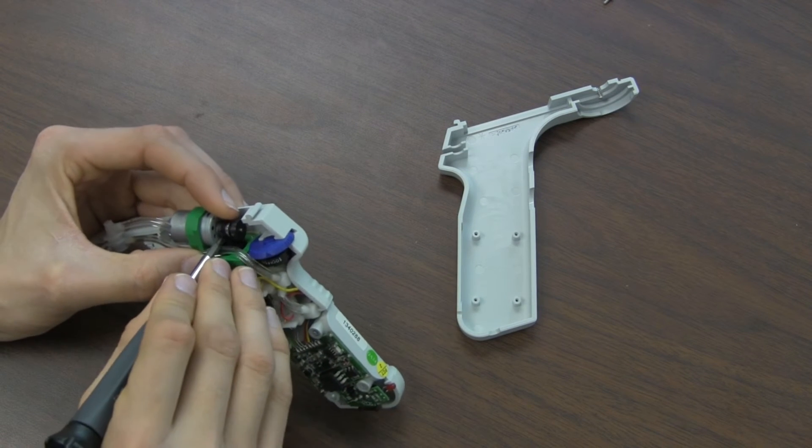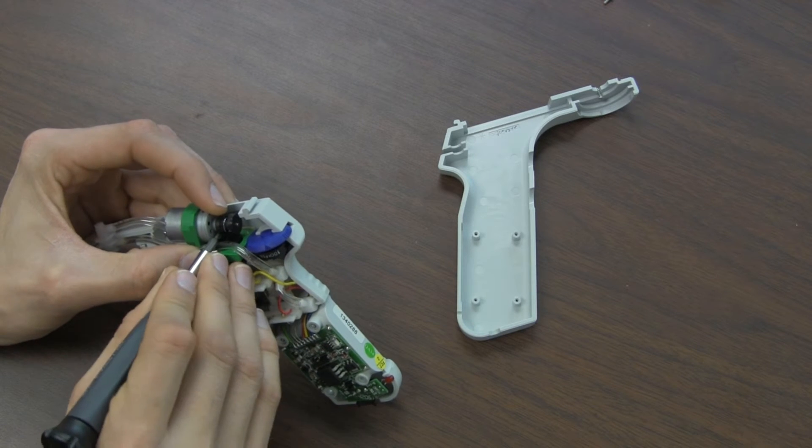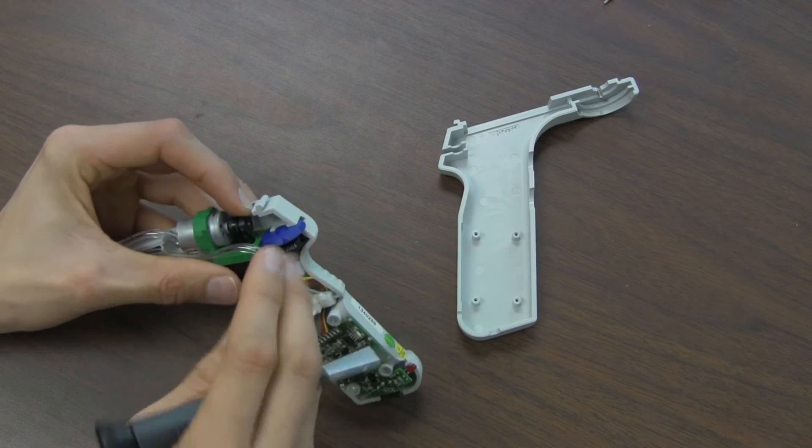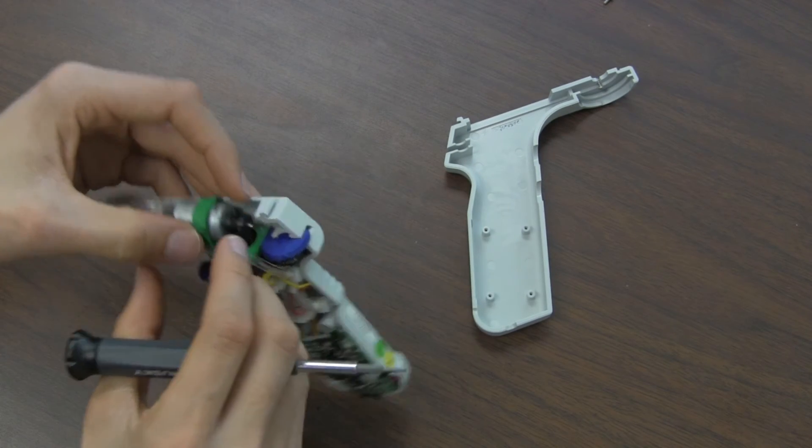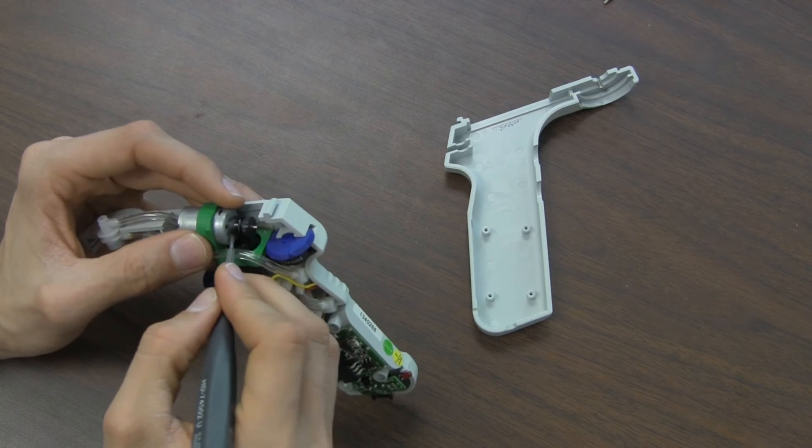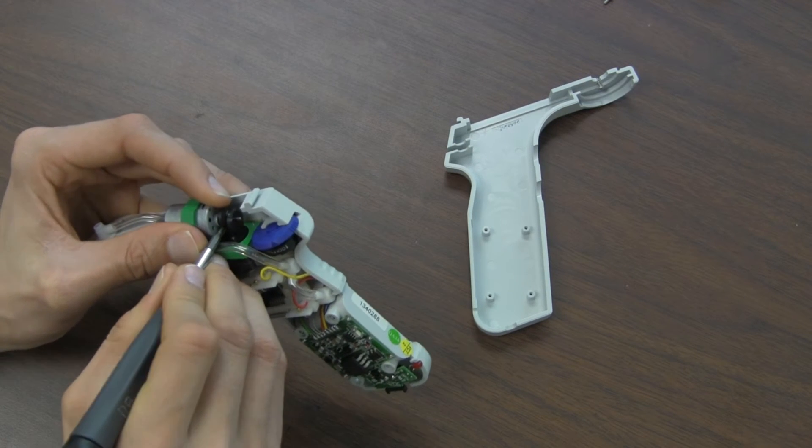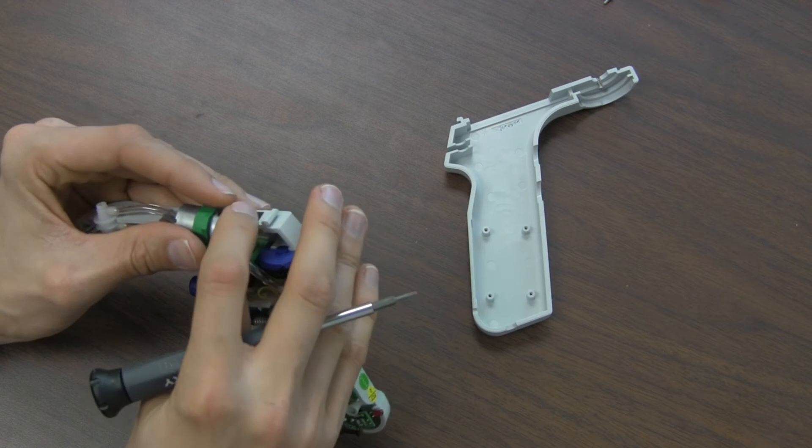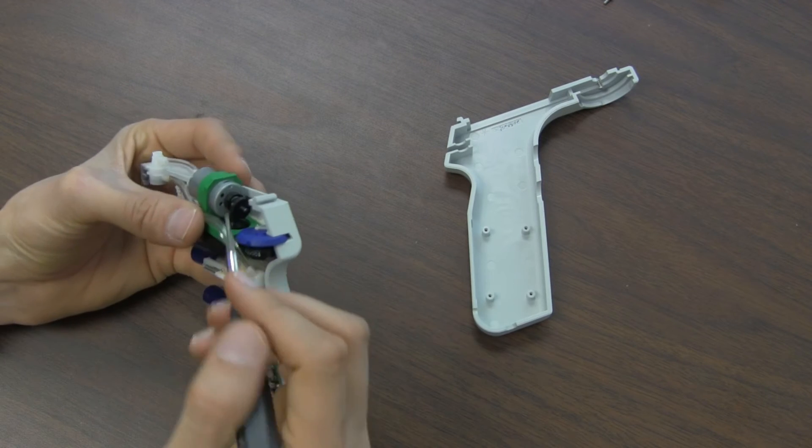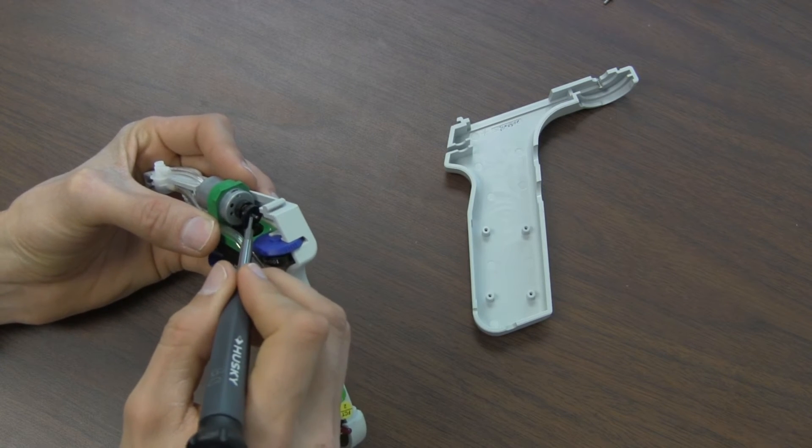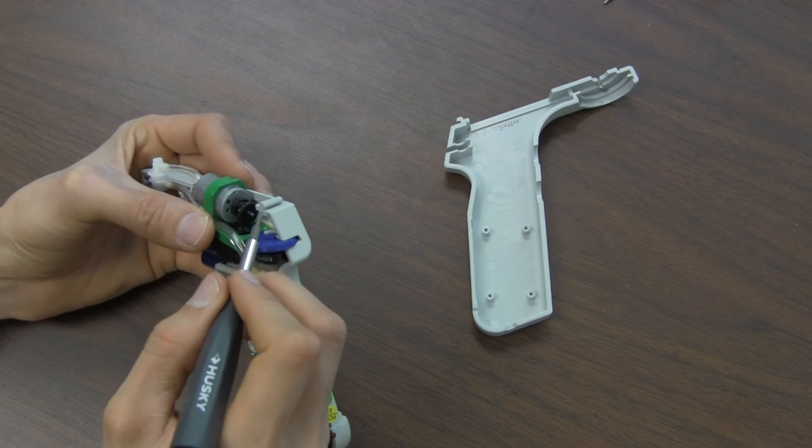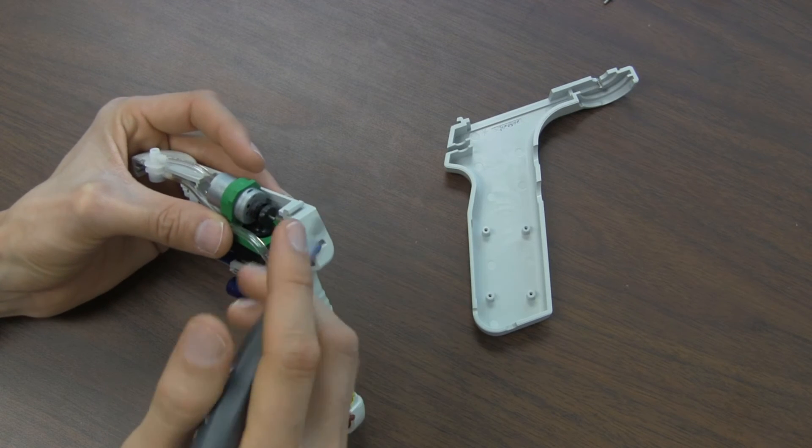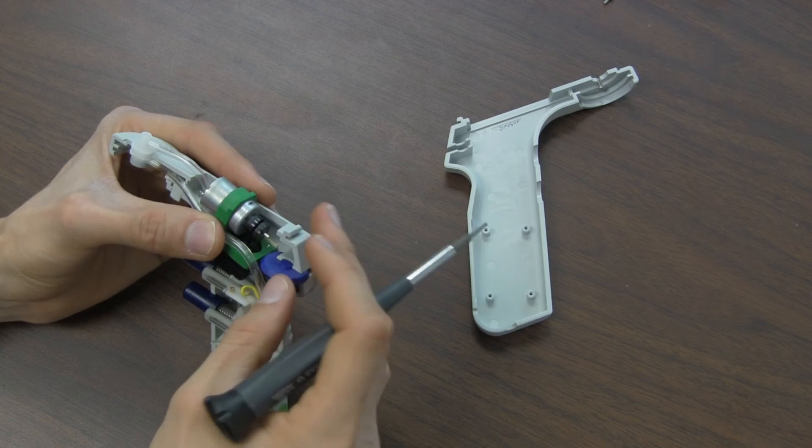The easy solution to fix this problem is to push the piston rod from the pump back onto the bearing and then slide back the whole assembly on the motor shaft until it pops back near the motor. Now you see that it slides along easily and I don't know how well it will stay over time. It may be that putting a little bit of super glue right here will prevent it from sliding down the shaft again, but it's a pretty polished shaft so that would be difficult. It looks like a design flaw on their part of just pressing it on there if it ends up slipping down like that.